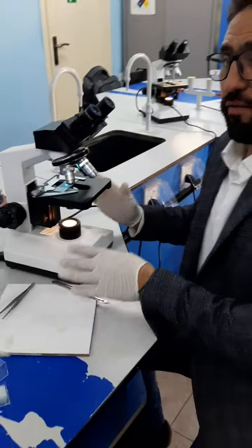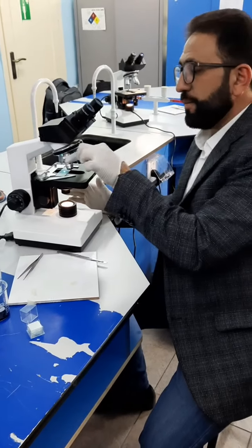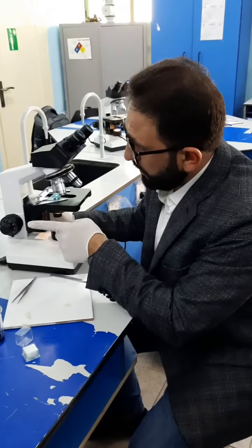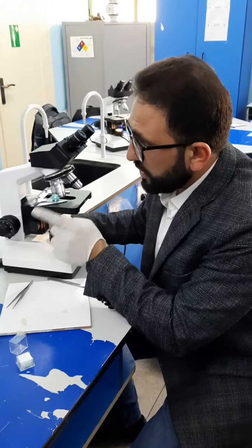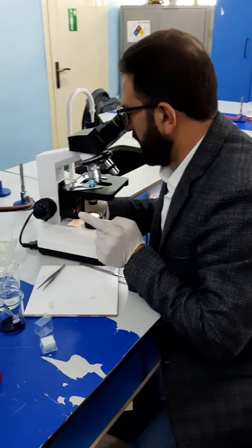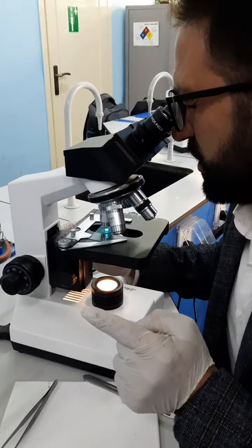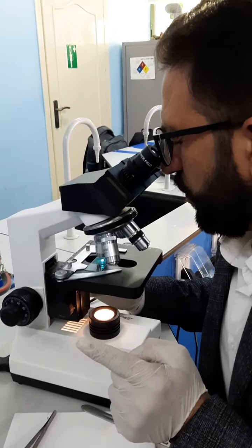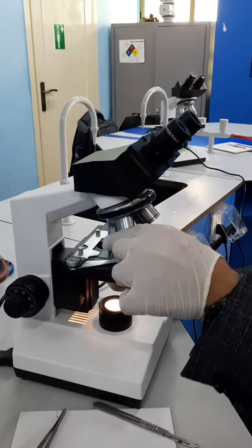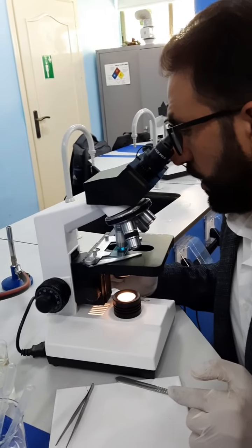Okay. Now, once you find the field of view, you need to go to the second lens, and in order to do that, simply rotate this disc. And the only one you use is the fine adjustment. Do not ever use the coarse adjustment again. It is only the fine. While you are looking, you're going to sharpen the image and you're going to see the field of view. You're going to see larger cells at larger magnification. Now, in order to magnify further, you can use the other lens, which is 40x, and again use the fine adjustment in order to see large cells.